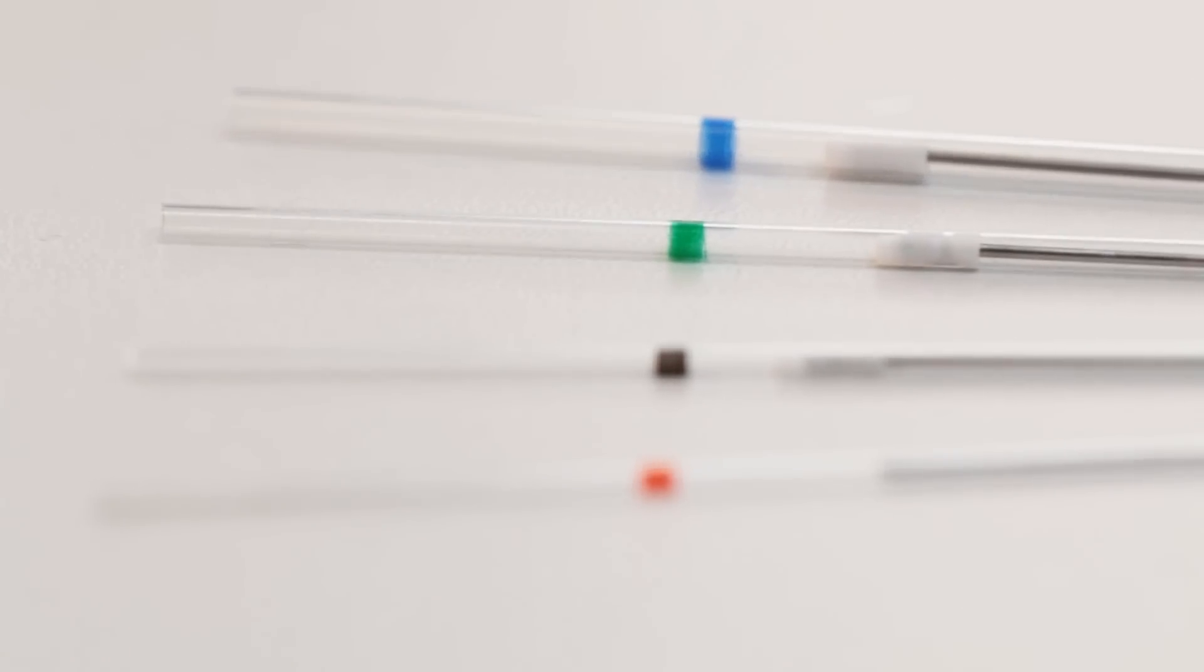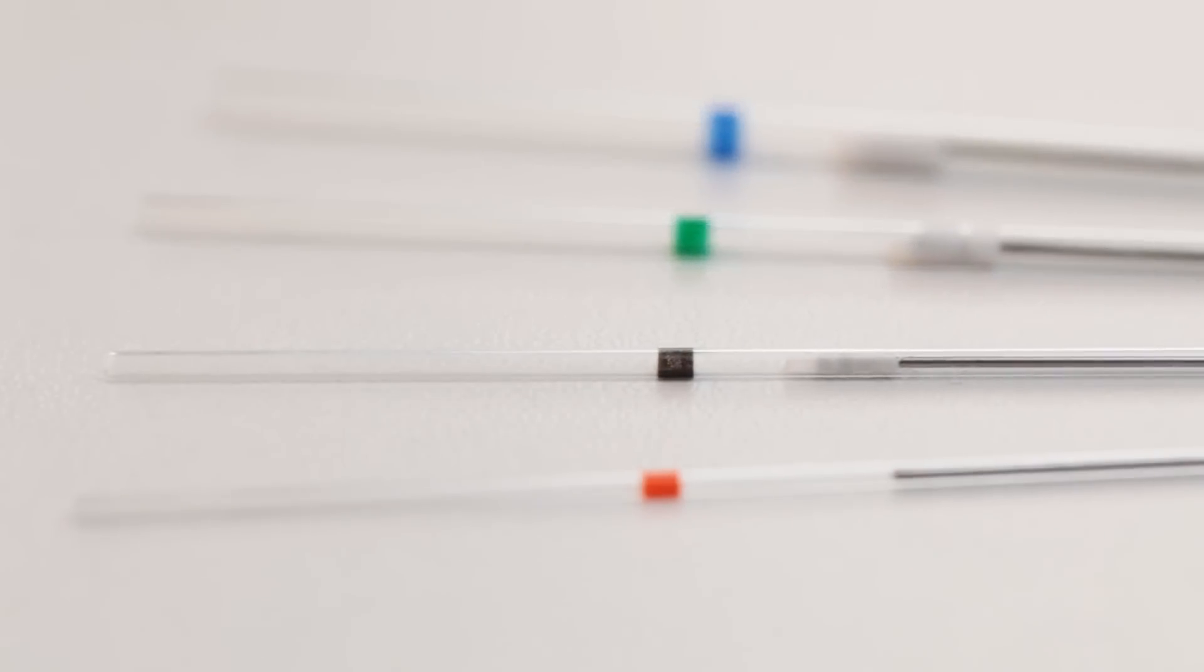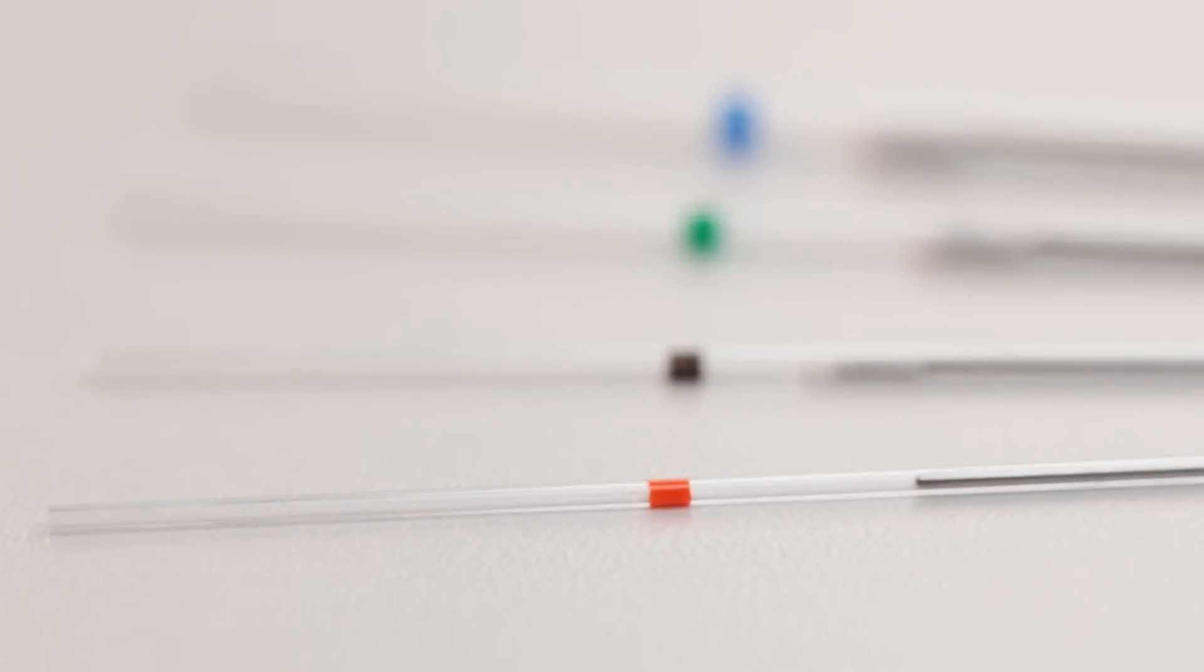Choose the right-sized embedding container. Capillaries from your Zeiss Starter Kit are color-coded according to their diameter or just cut off the tip of a one milliliter syringe.